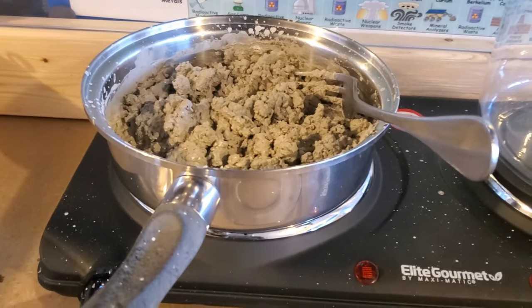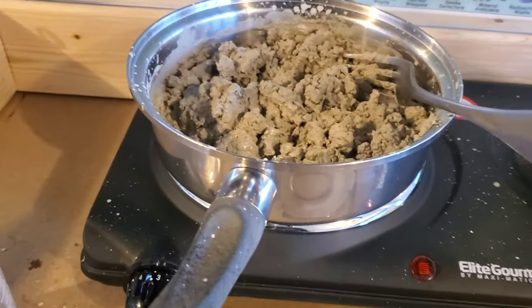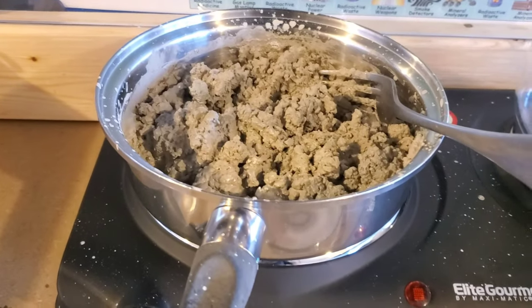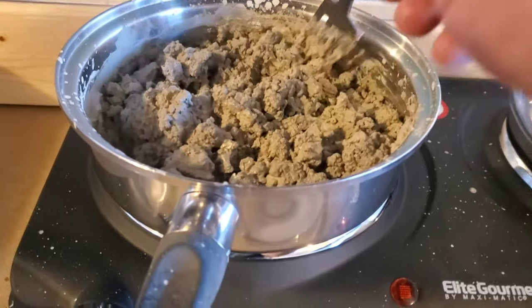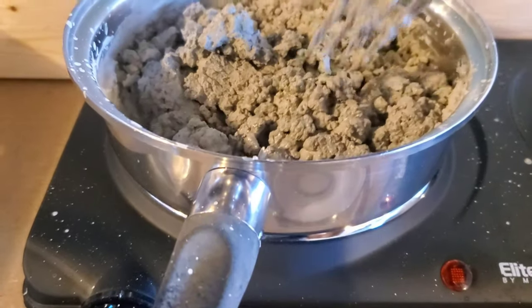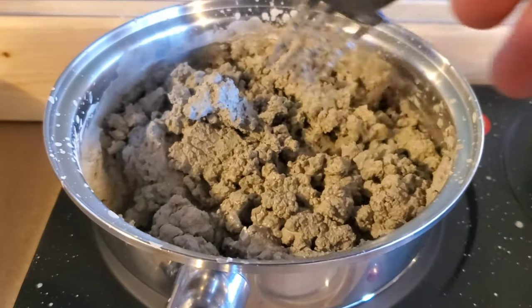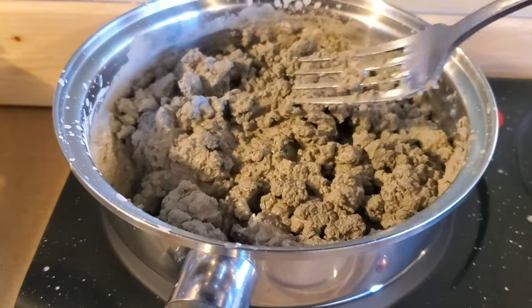All right, so after filtering all that silver, which was tedious and quite boring, now drying our final product here. Looks like we got a pretty good yield.